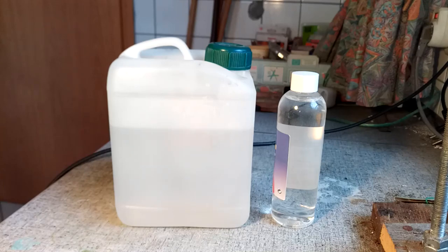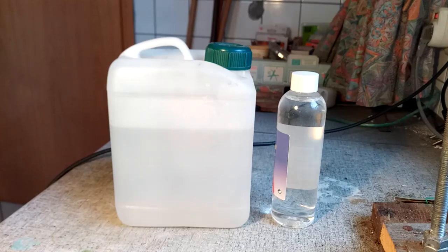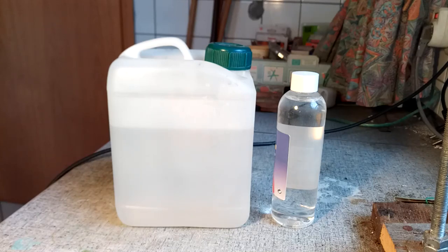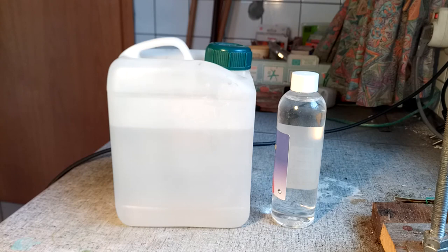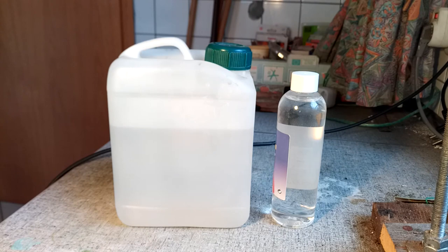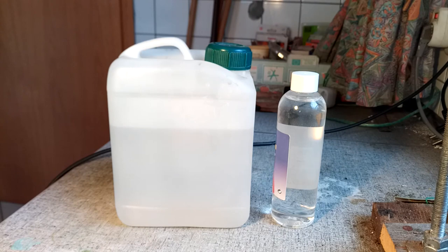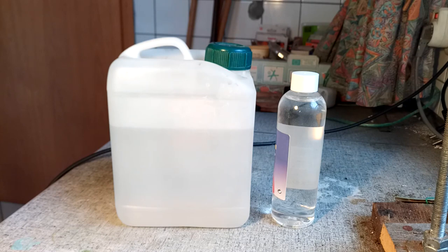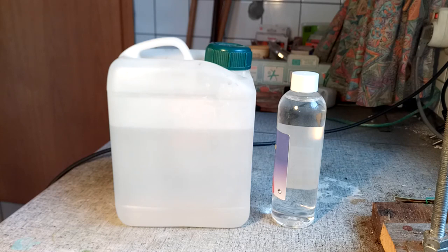Hey everyone, today we will make a bit of allyl alcohol, which is a reagent in a synthesis project that I have planned.